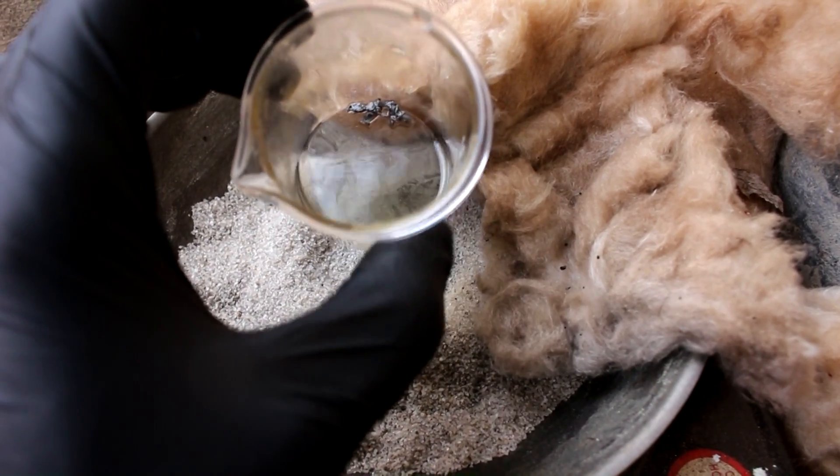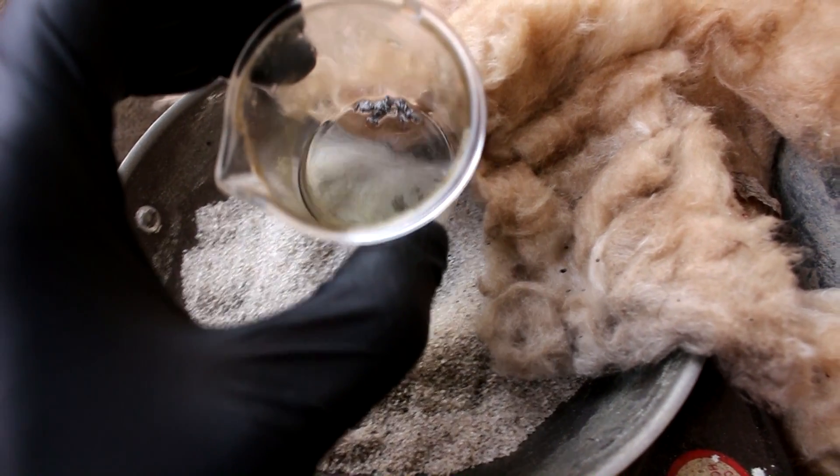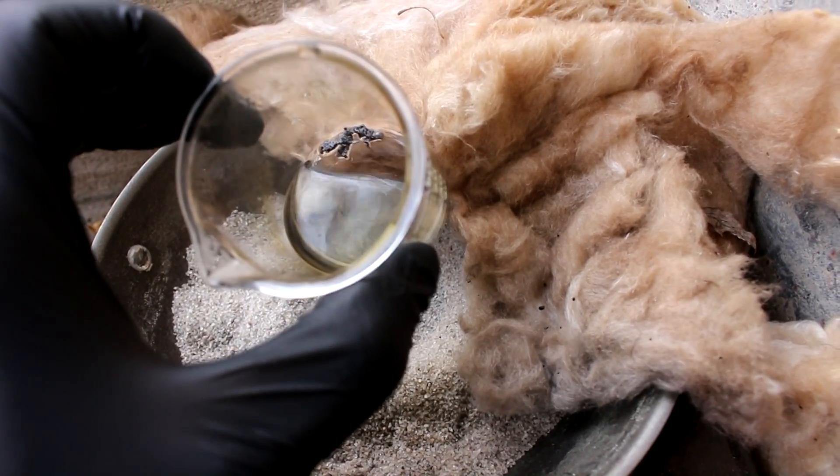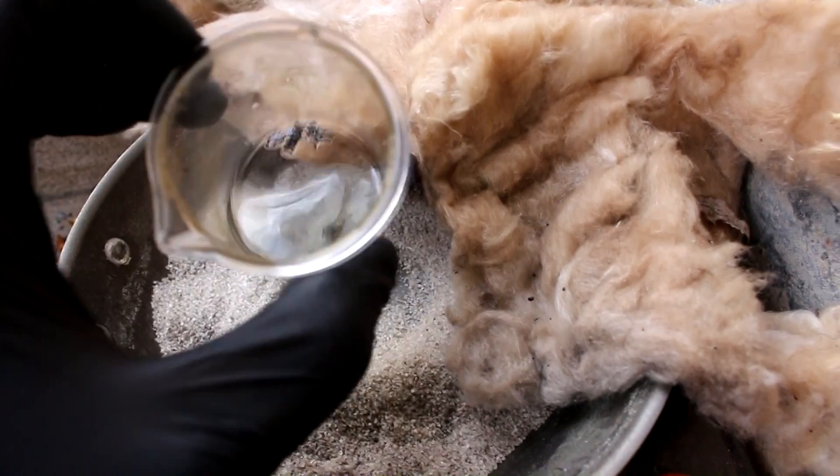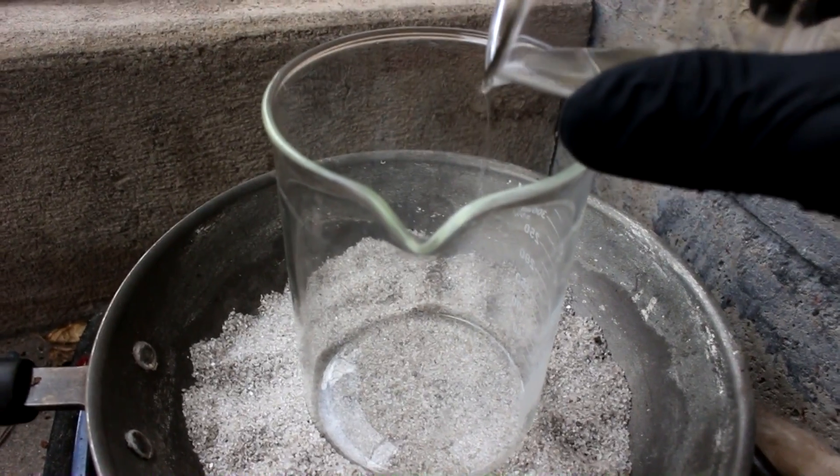And as you can see, I'd say around 80% of it was dissolved. So I think I'm going to call that good enough. I'm going to take this out of there. Let's just pour it off into this large beaker to evaporate.